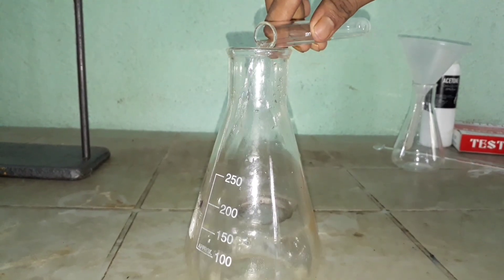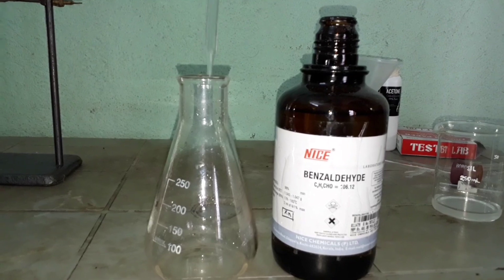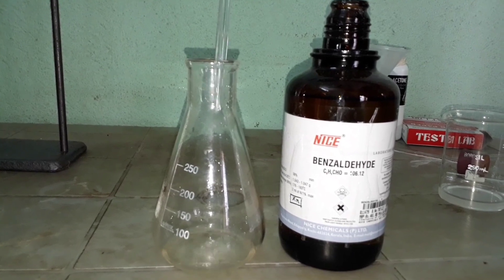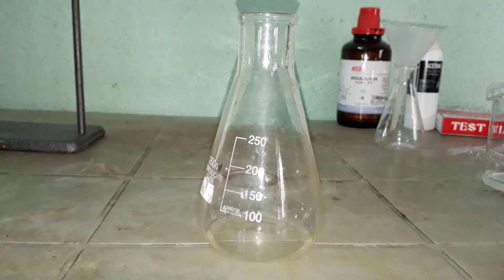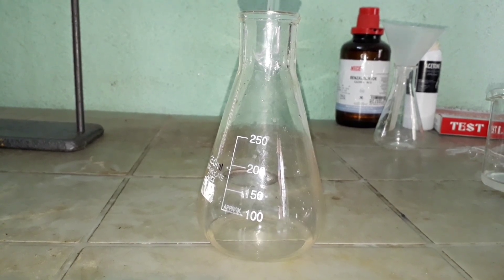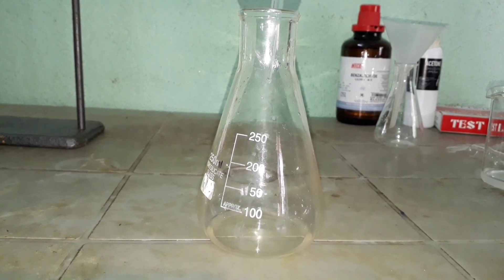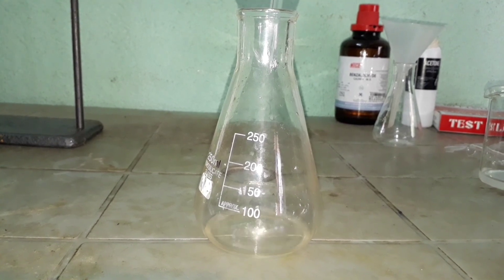About 2 ml of benzaldehyde is added, then concentrated NaOH is added dropwise into the solution. After adding the NaOH, the Erlenmeyer flask is closed, and now let me discuss the mechanism of the reaction.